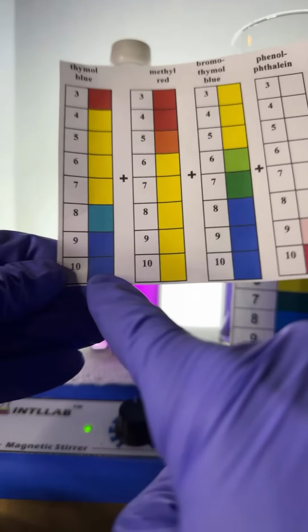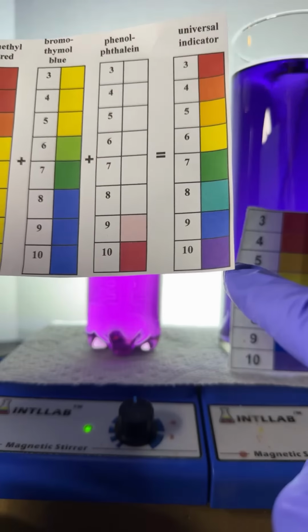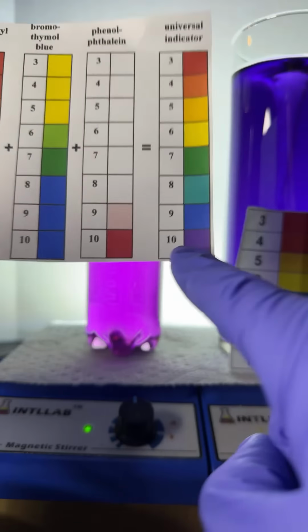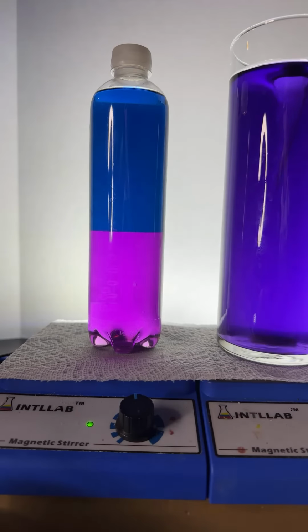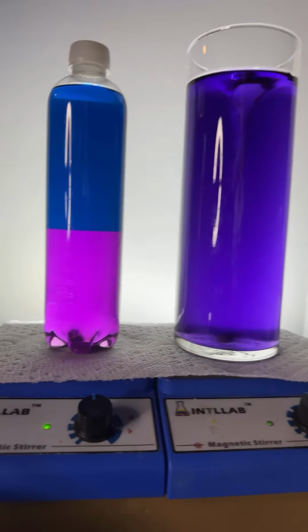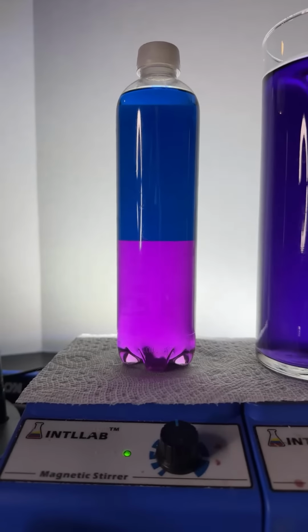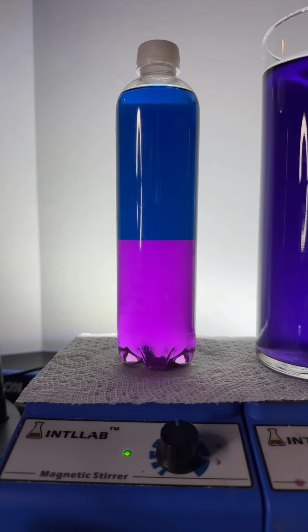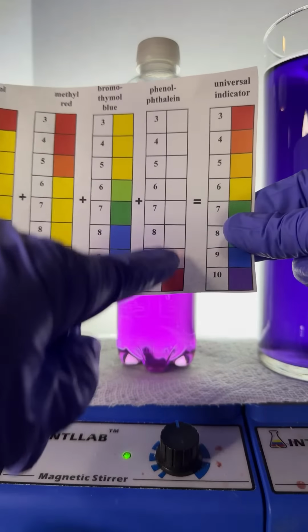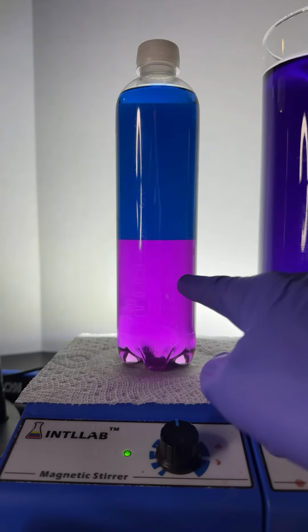Anyway, at pH 10, you add all these colors up together, and it usually looks violet, right? Blue and a little bit of yellow and a nice red color is going to give you a violet. And that's what we have over here. We have a pH 10 solution over here. But this is well mixed. Over here, we have the same dye in there. It's got the same 4 substances in it. But it just so happens that this one, phenolphthalein, at high pH, dissolves in the saltwater layer.